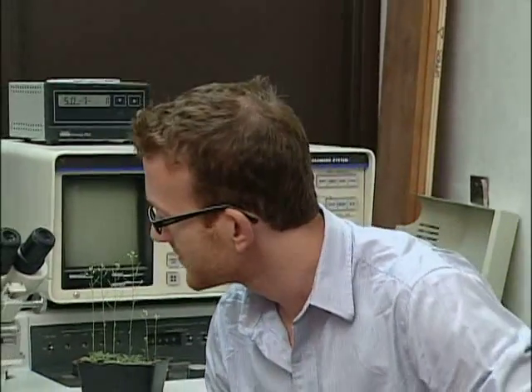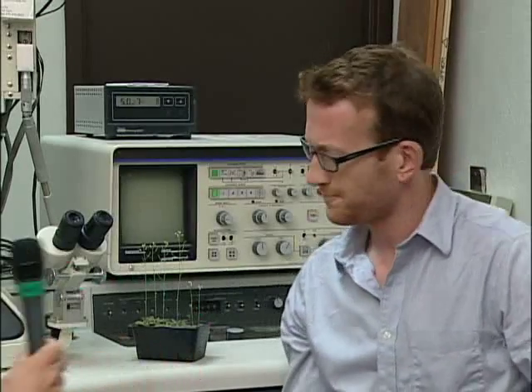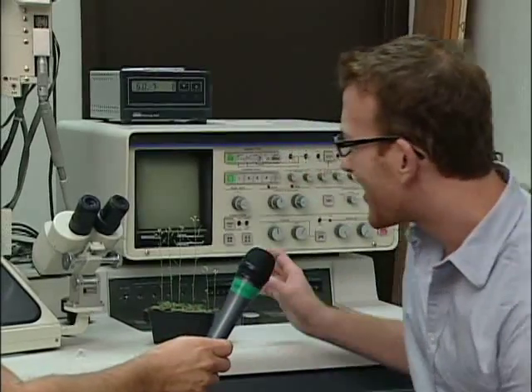And how do you use this piece of equipment in your own research? Well, I use this piece of equipment to examine these ultrastructural components of the cell. Specifically, I use this microscope to examine oil body formation within endosperm cells of Arabidopsis. So is that Arabidopsis here? Yeah, exactly. So what does that mean? You take a look at Arabidopsis.